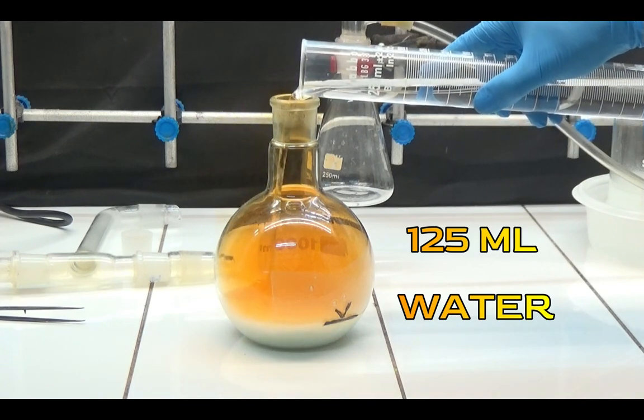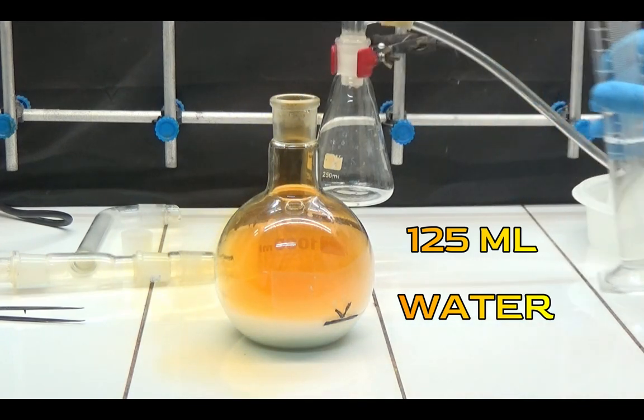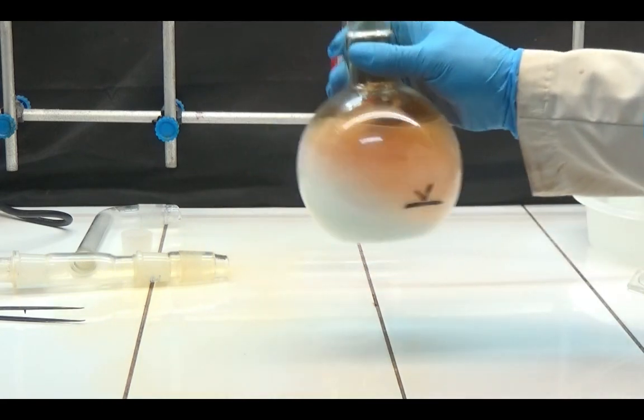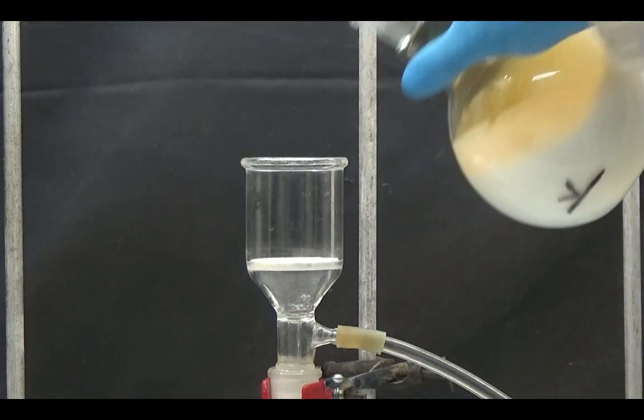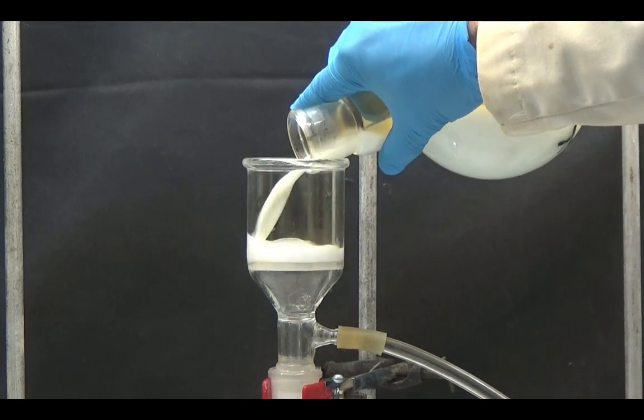Add 125ml of cold water to the flask and shake it. Suction the white solid into a funnel to collect it.